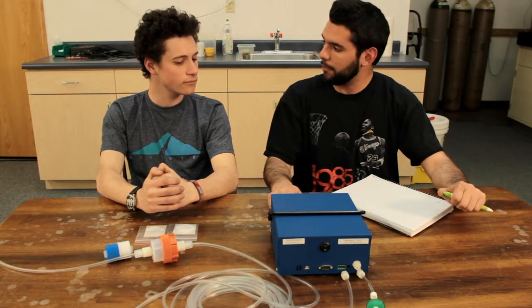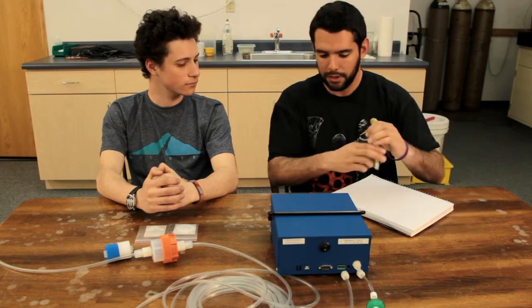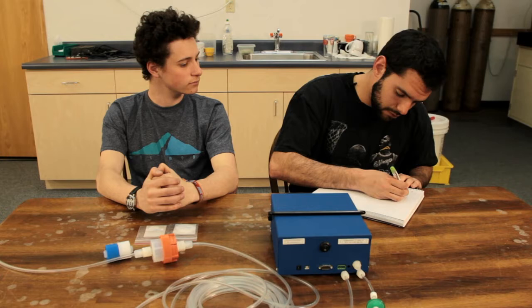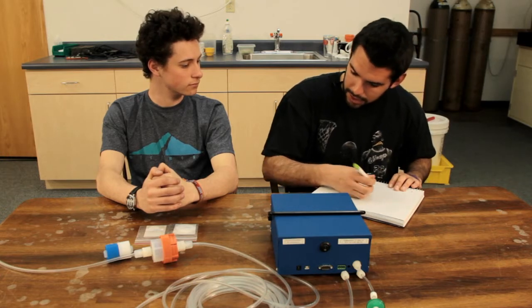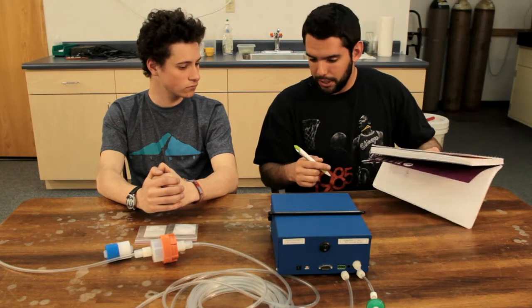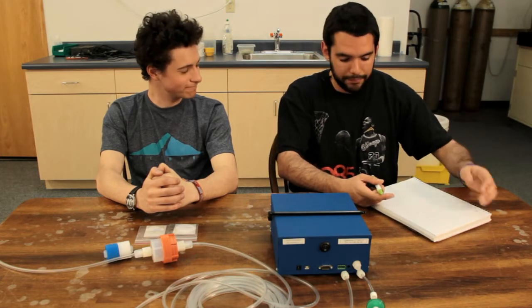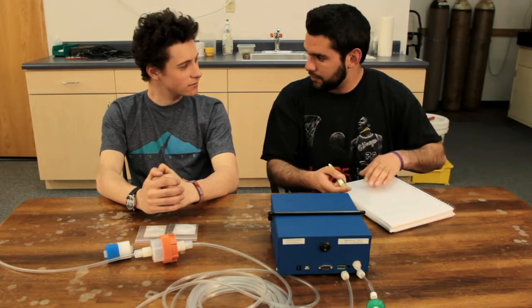Once we've done that, we'll go back to the main display screen on the monitor, and we'll take about 20 measurements of what's going on. So I'm doing my measurements, and once I've got my measurements, I'm going to go ahead and turn those over to Scout. She's going to throw them into an Excel sheet and get an average for us. So Scout got an average of -2.